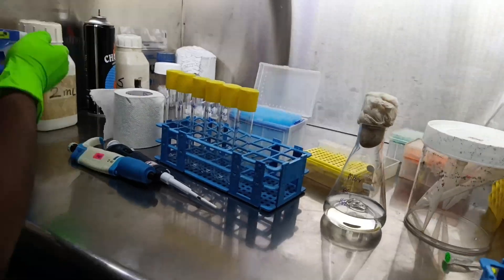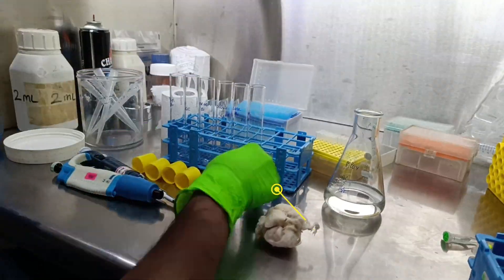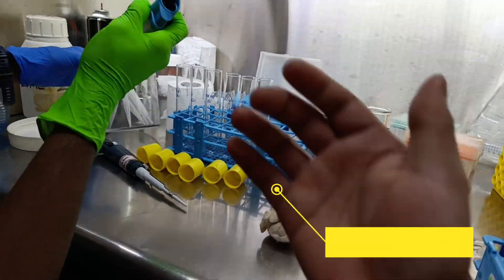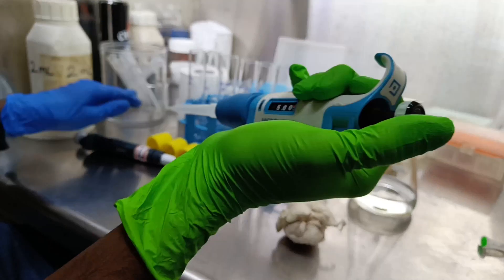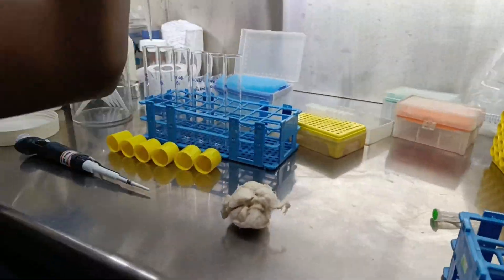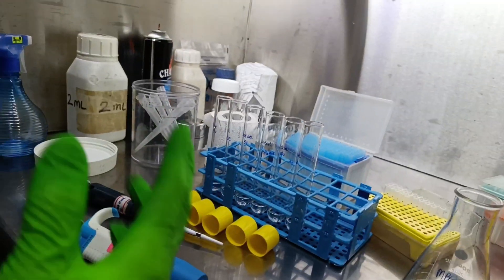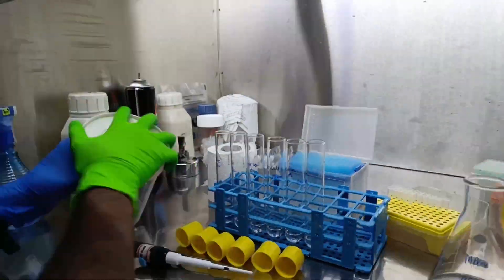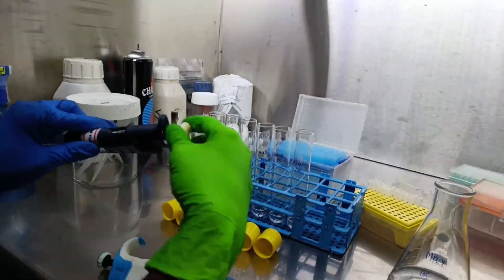The last thing of the day is to give inoculum from primary cultures to secondary cultures, which will be required for the next day. As the Mycobacterium smegmatis grows very slowly, they will be kept in the shaking incubator overnight.